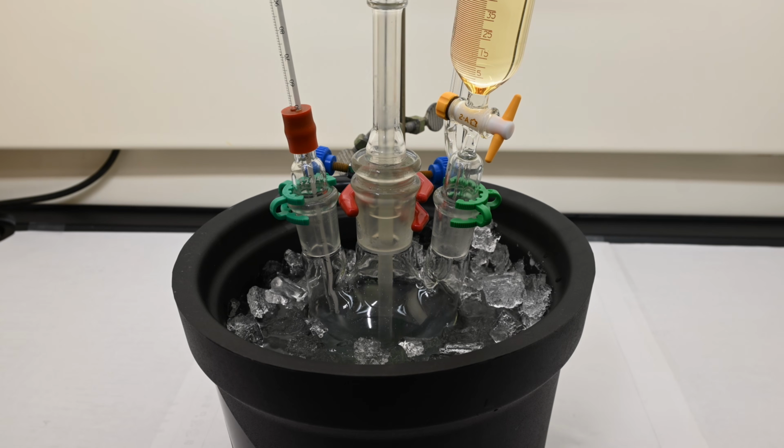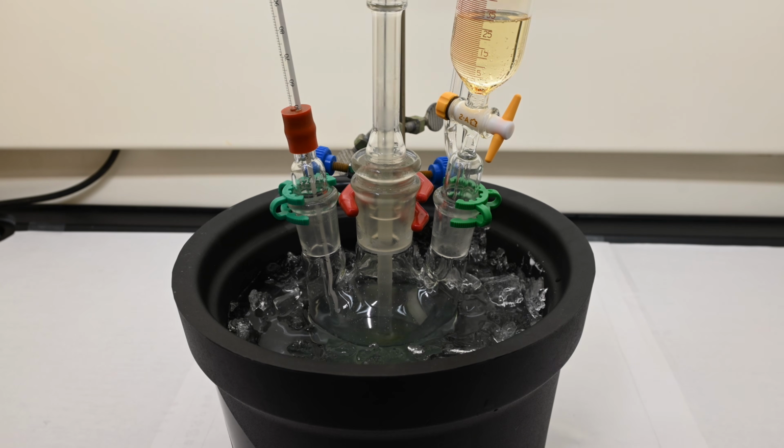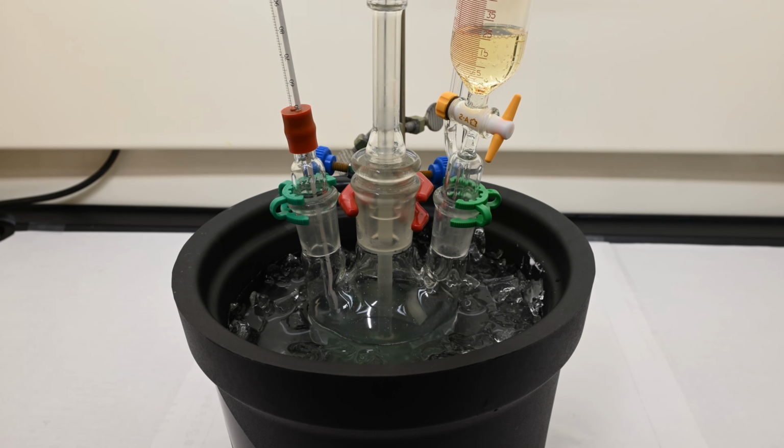Throughout this process, the mechanical stirrer works to keep everything evenly mixed, preventing any hot spots. This gradual addition can take anywhere between 30 minutes and 2 hours, depending on the rate of addition needed to keep it in the proper temperature range. Even when you add it slowly and keep things cool, you might still notice a little nitrogen dioxide forming, the reddish-brown gas often nicknamed Red Death because of its toxic nature.